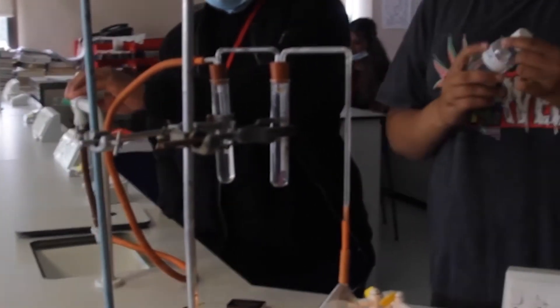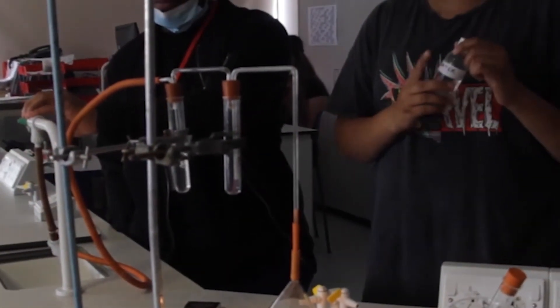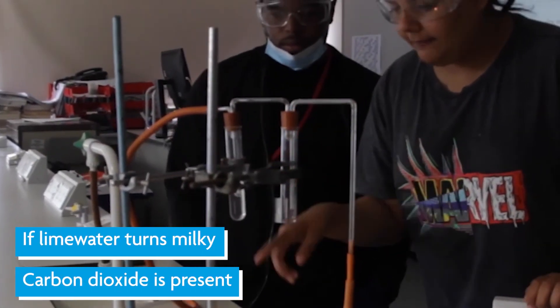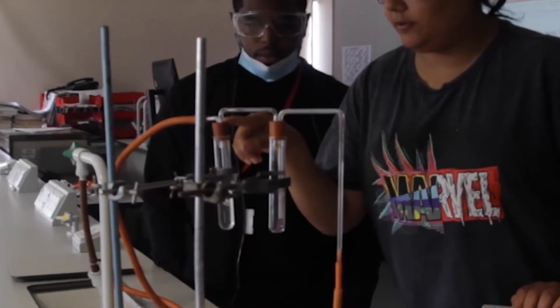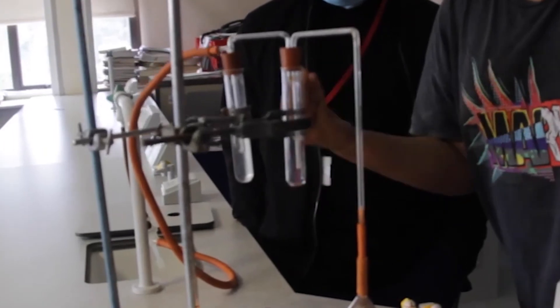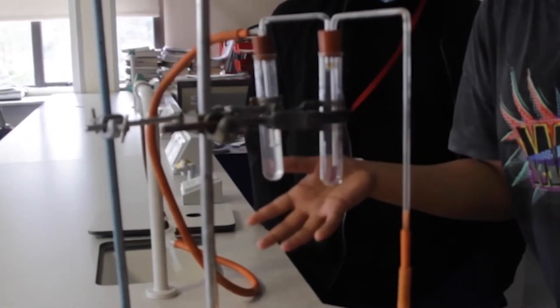For lime water, we are trying to investigate if there is carbon dioxide present. When the product is transferred over here, if the lime water starts turning milky, you can see that carbon dioxide is present.